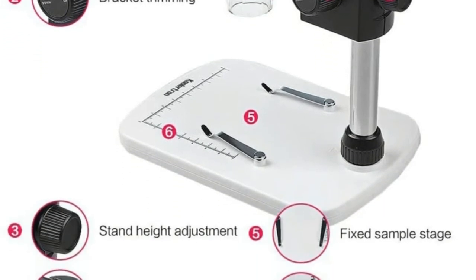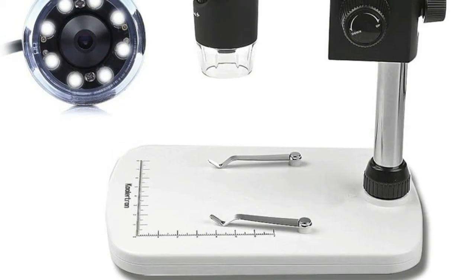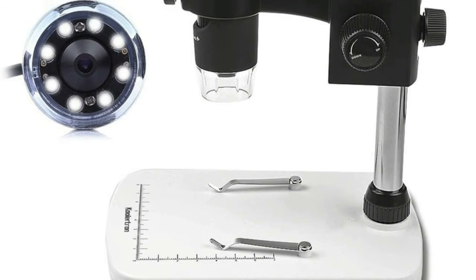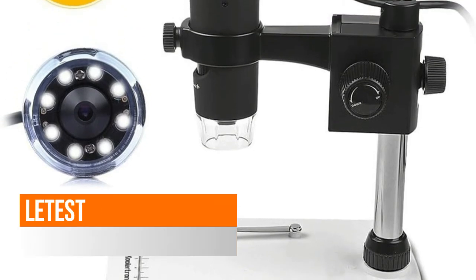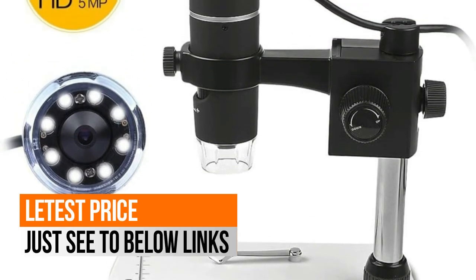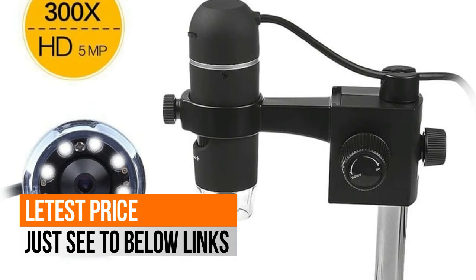Making saving and sharing videos and still images easy. With the digital microscope's own metal material stand, it's very convenient to adjust the height. Good for hands-free operation.